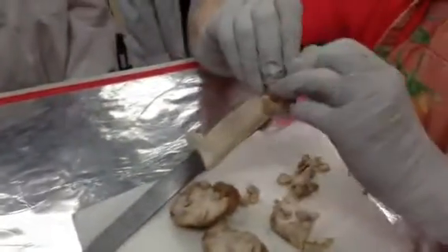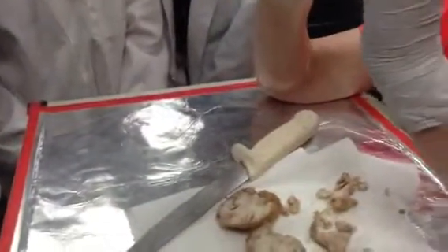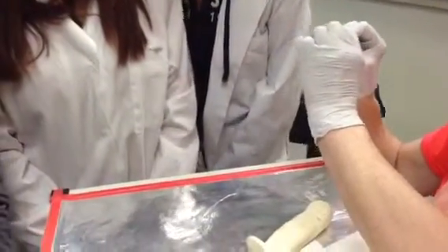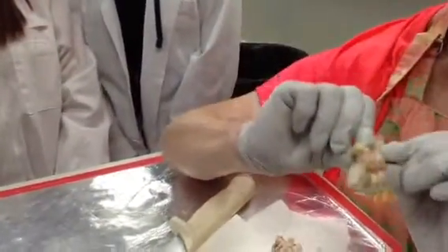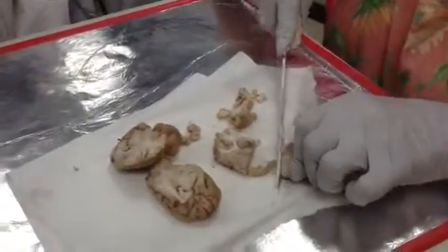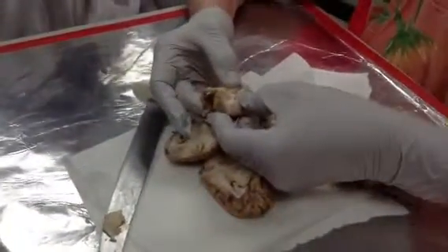Okay? You can also see it if I open this up a little bit. That's a central canal for the cerebrospinal fluid to go down through the spinal cord. Okay, got the idea? So this is one example of a spinal cord or a brain stem. Got a little bit of extra, but it kind of gives you a good idea of where things are.